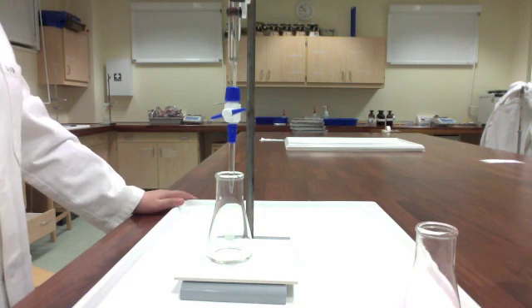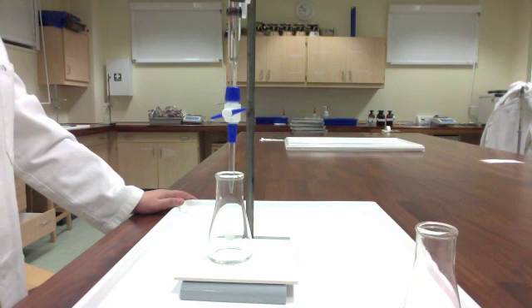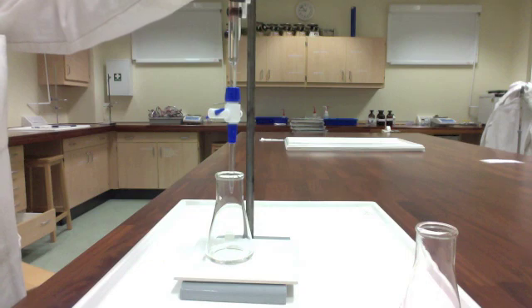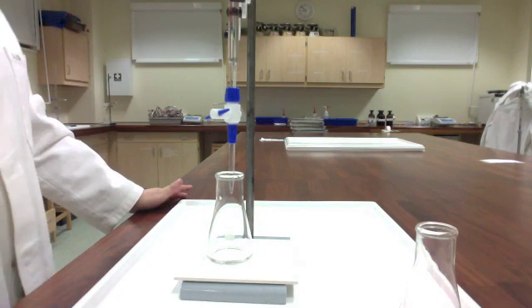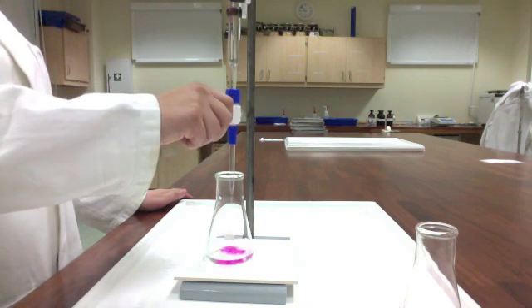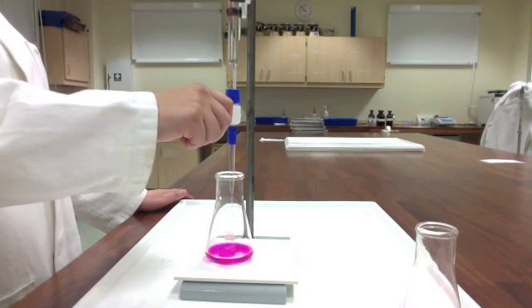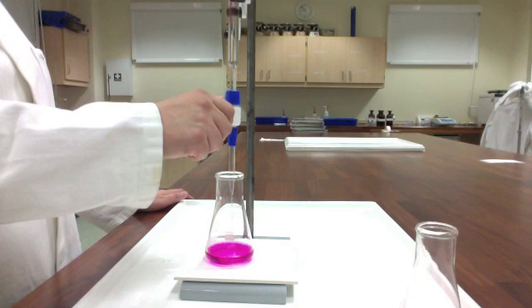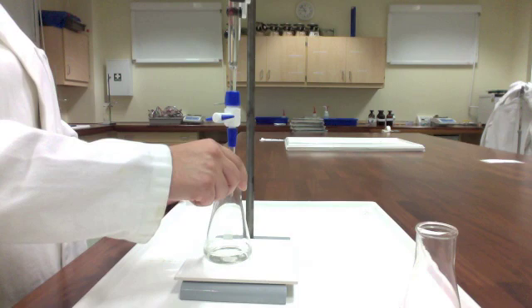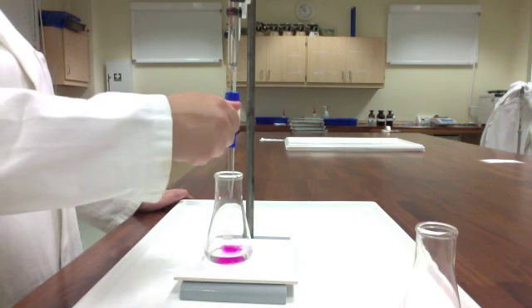Now, quickly doing some math in my head, I know I can add about nine milliliters very quickly, which brings me to, if my math is correct, 23 milliliters. I'll just turn that so I can see it. So I know that, basically, I can just open this stopcock and let it run to 23 milliliters. I'm not even swirling right now. You might choose to. But you can see, when I stop and swirl, everything goes away. I'm not quite at 23 yet. There we go.